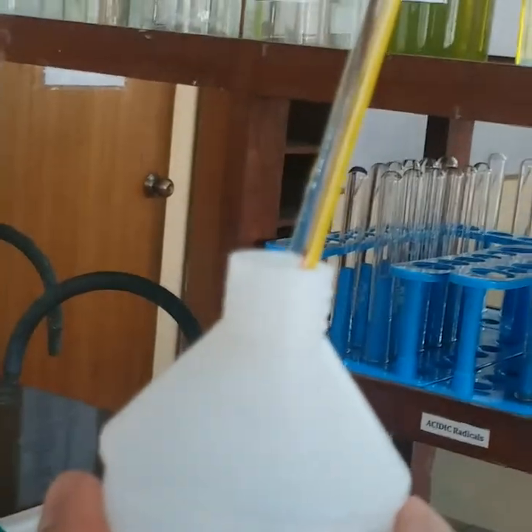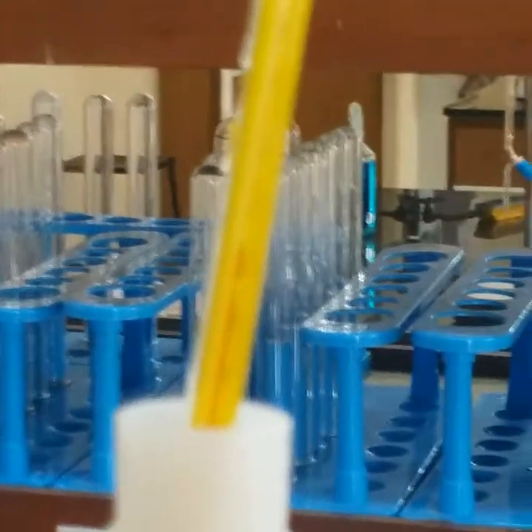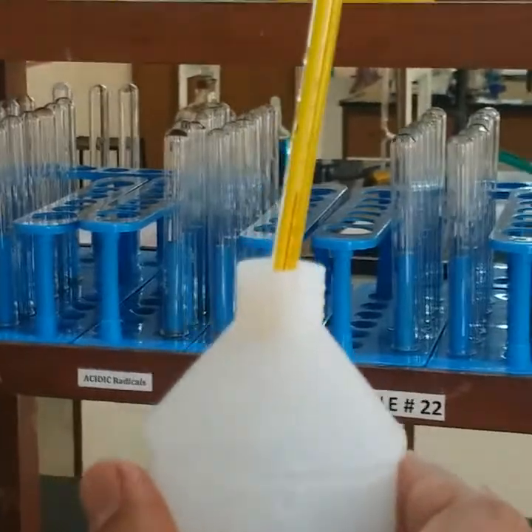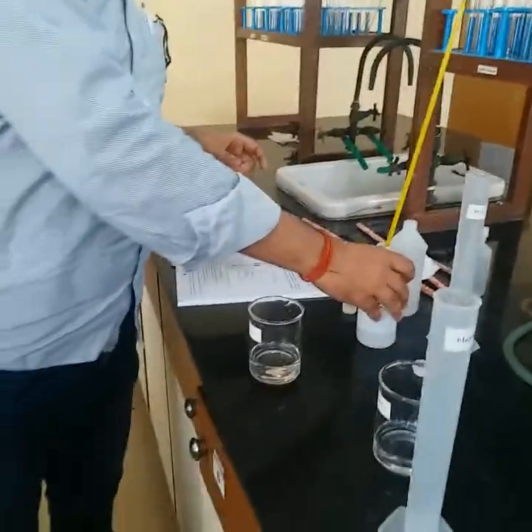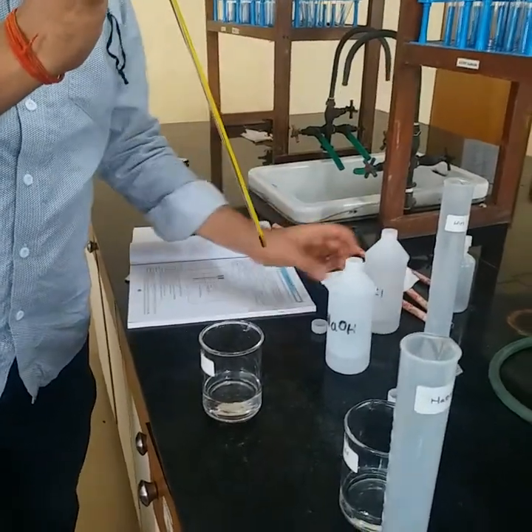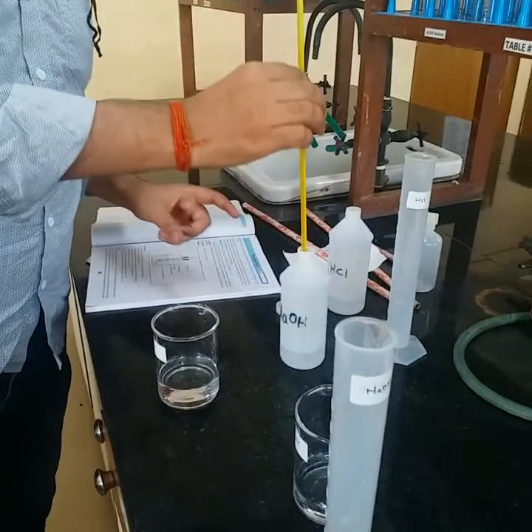We have to wait at least one minute. The temperature is rising — you can see 28, 29, 29.1 — and this is also 29.5°C. So both T1 and T2 are 29.5°C. T1 is the temperature of HCl and T2 is the temperature of NaOH.